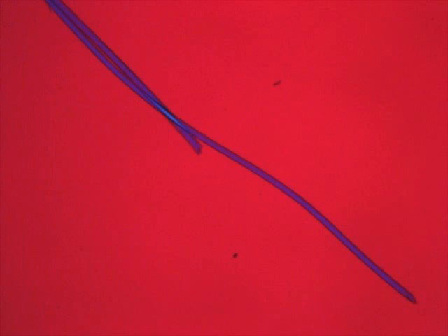After the previous fiber is rotated 135 degrees, it changes from first order orange to first order blue. Because it does not move up in order, the acrylic fiber is determined to exhibit negative elongation.